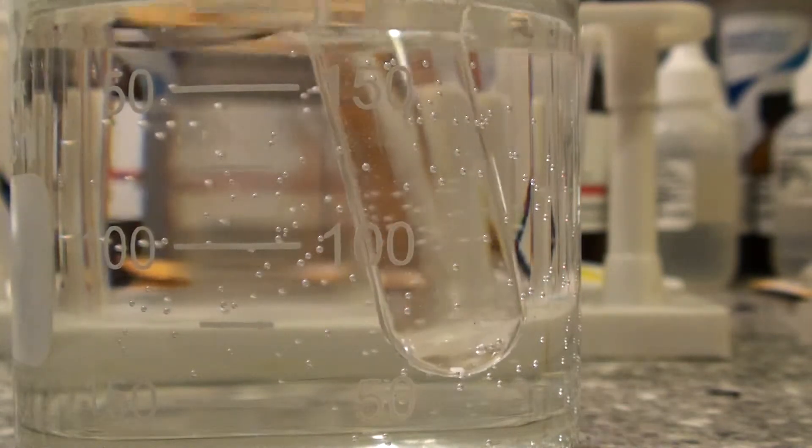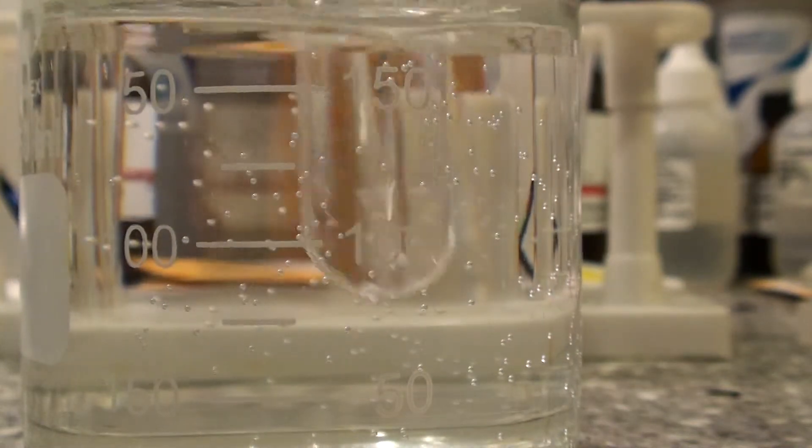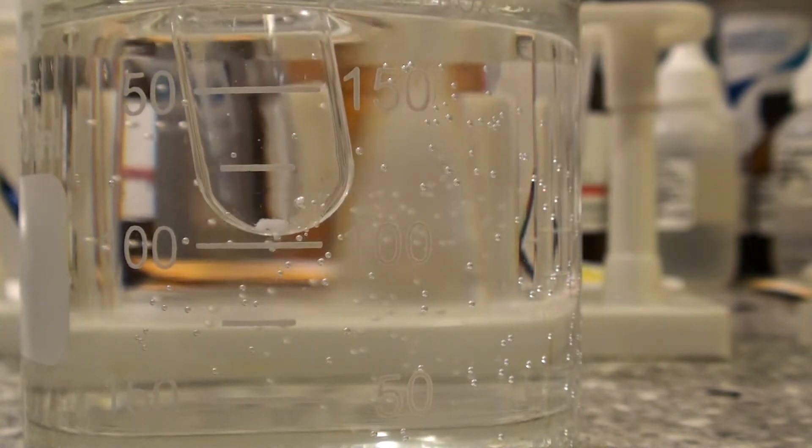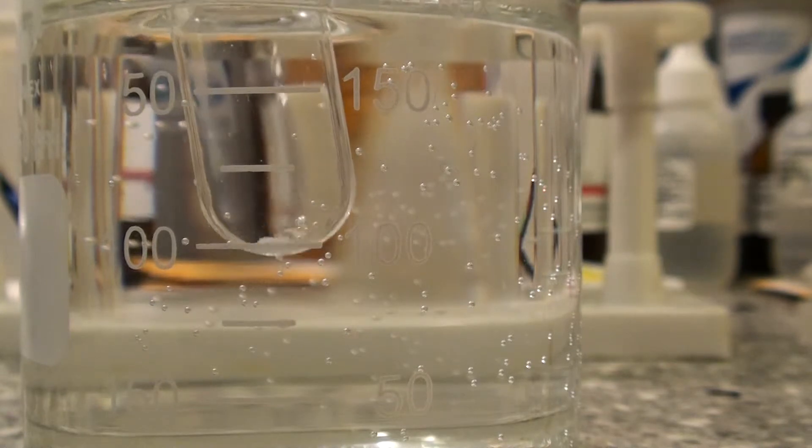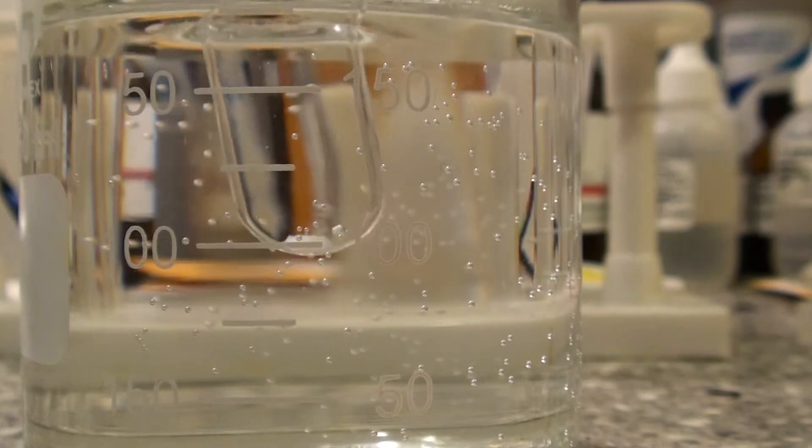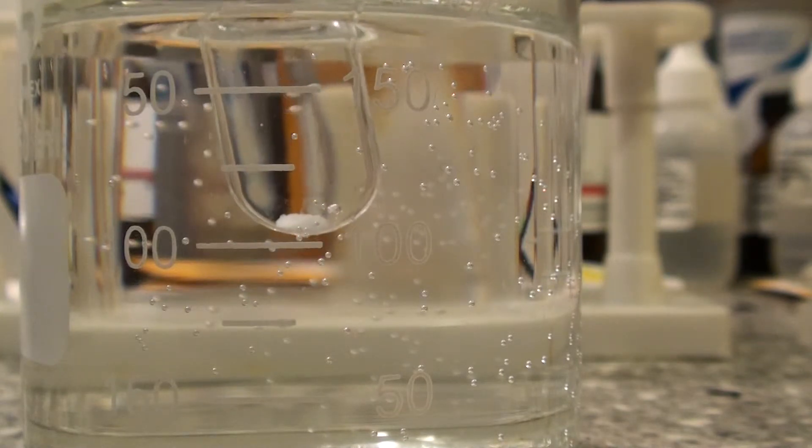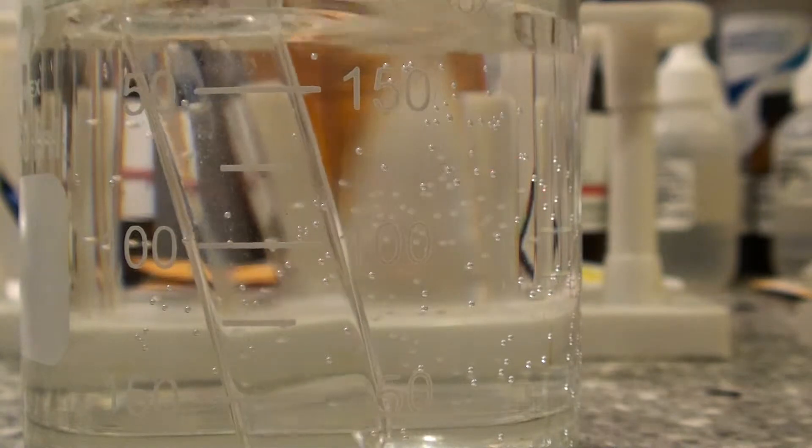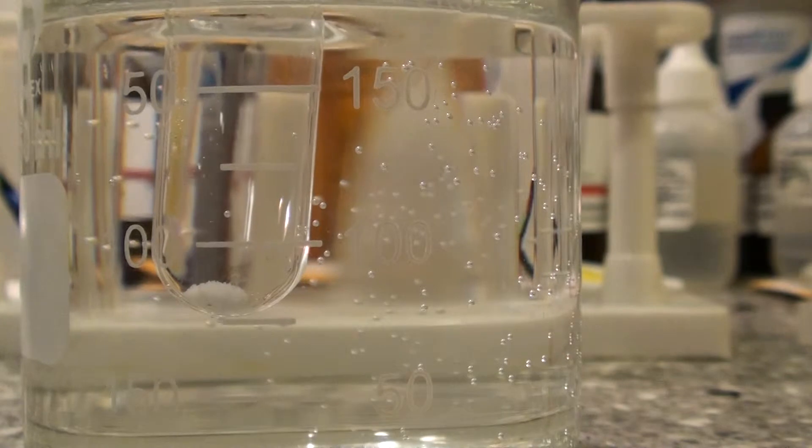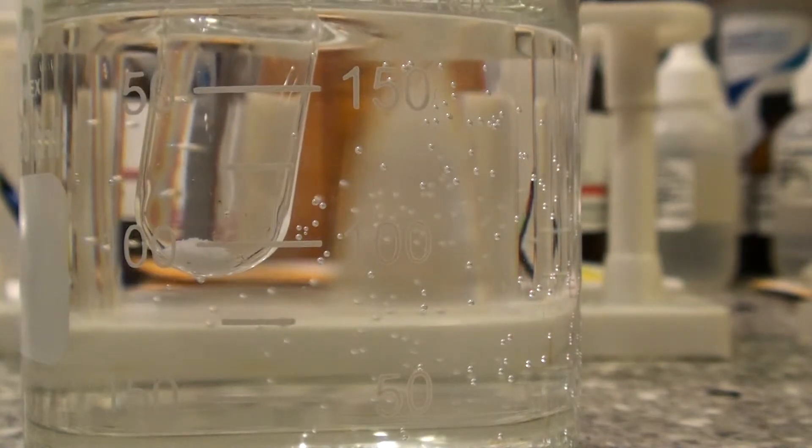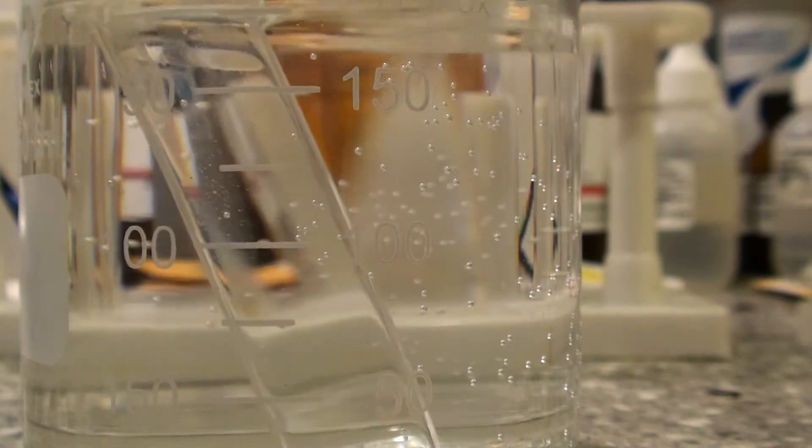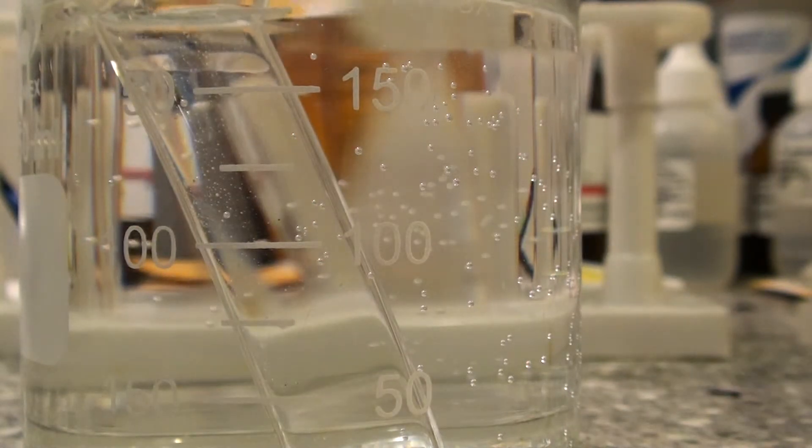Okay, I'm waiting for this to actually start forming. Oh, it's forming at the bottom. That small white crystal. The bottom of the test tube is the Ammonium Chloride. It will slowly start to build up. It shouldn't take that much time. It will grow up to be a large crystal by the end.